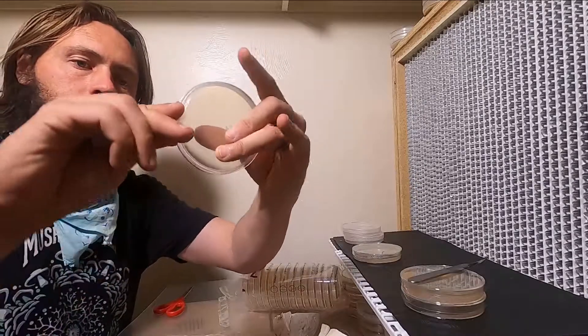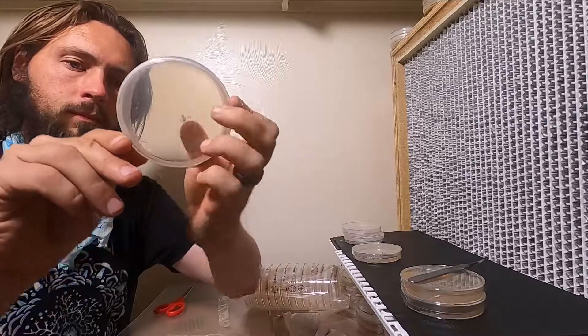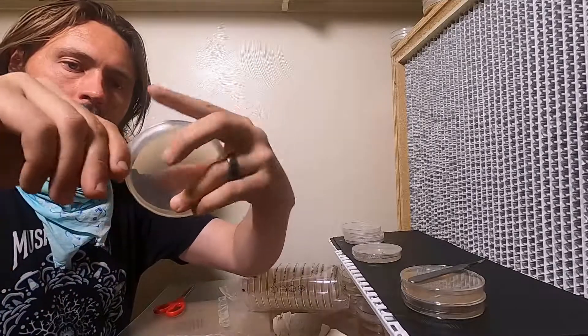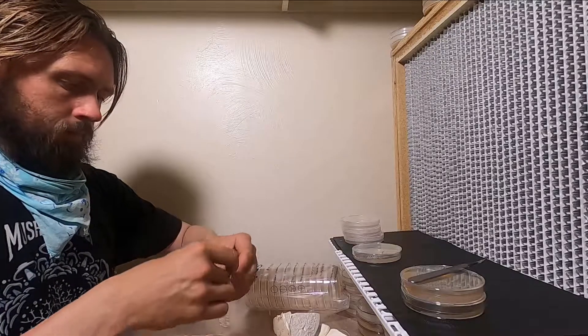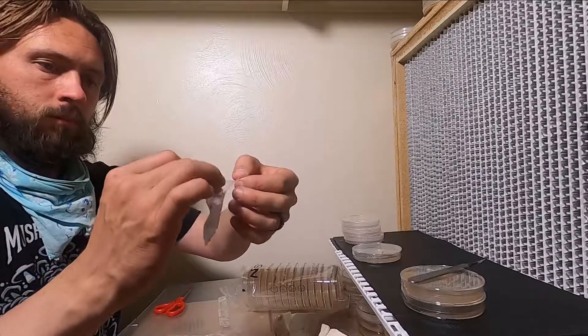Worst case is I'll make some spawn and put it outside. See if I can get any growing in the yard. This is kind of just an experiment. I'm just getting a starting culture and if this remains clean for a few days, then I will move on to the next step.